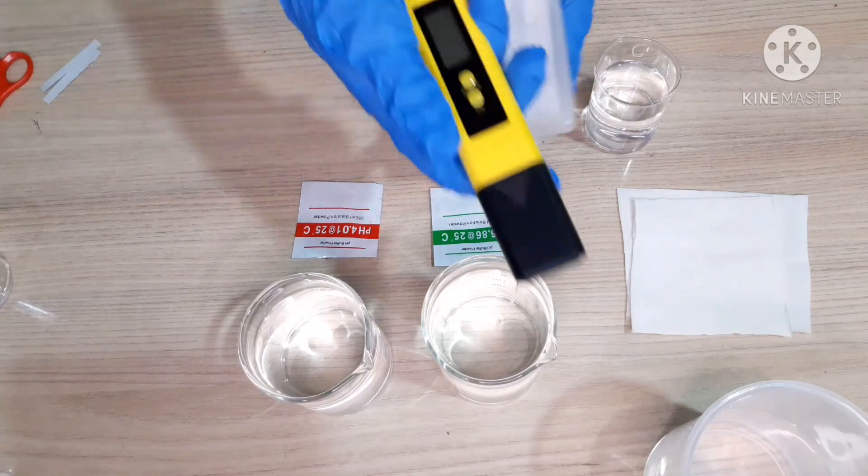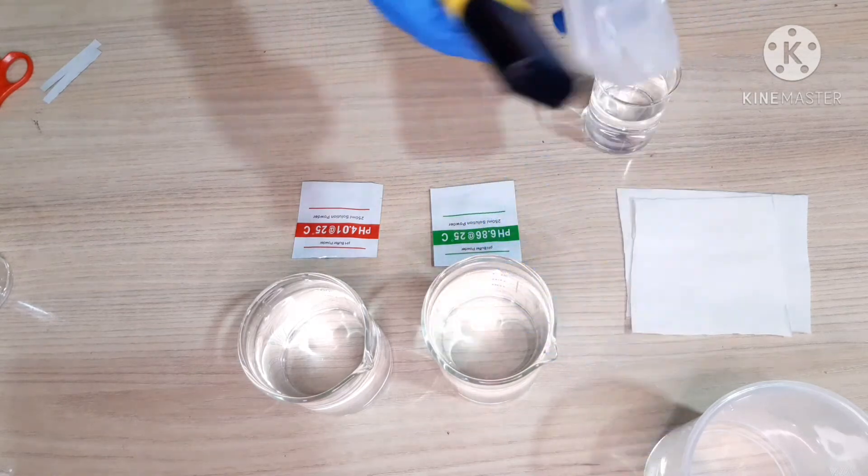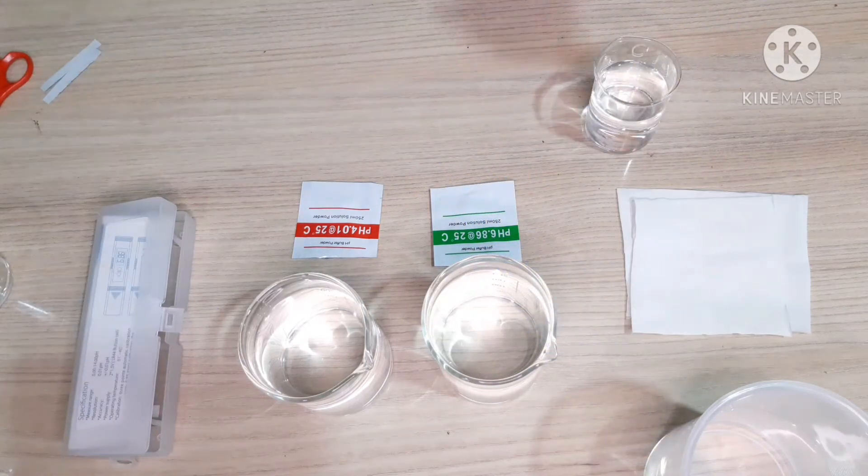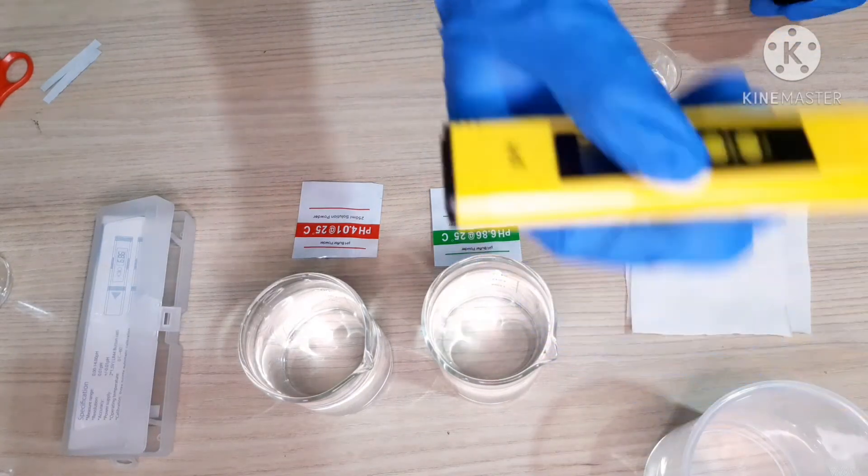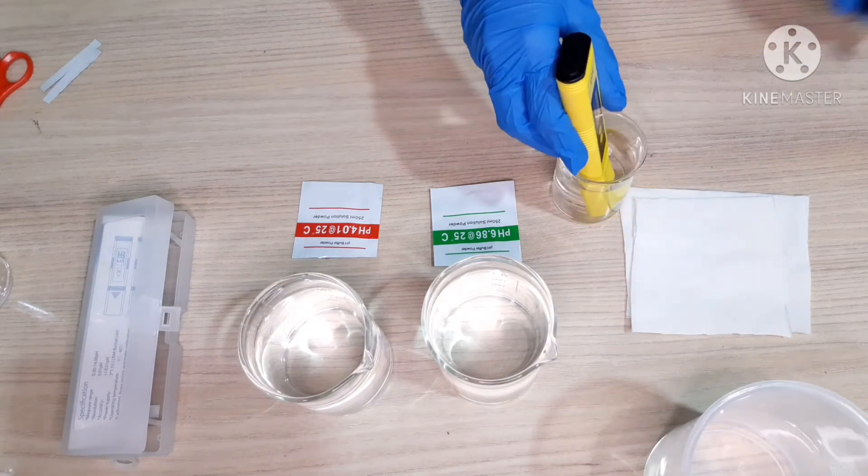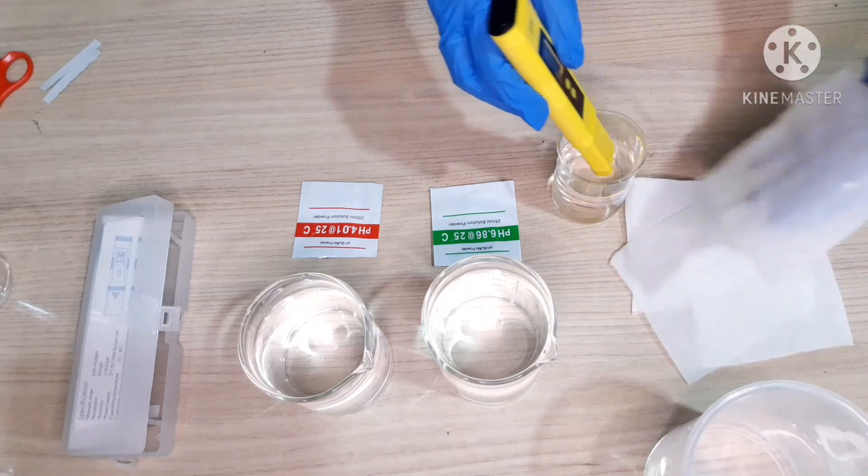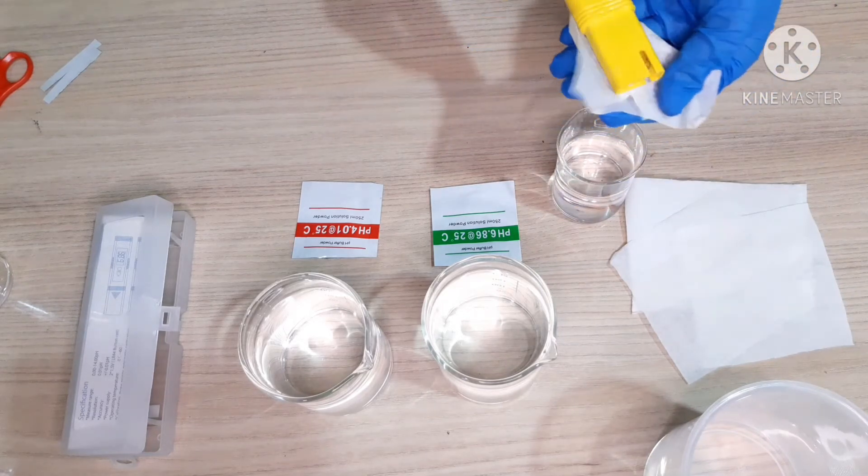This is the pH meter from Nexquam. I will put the link in Amazon if you want to buy this one. I will first put it in distilled water and clean it with a paper towel.